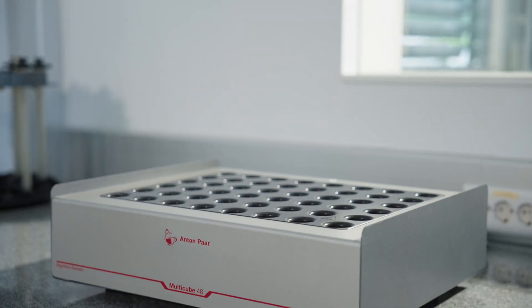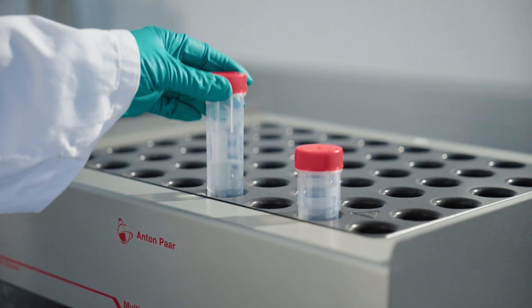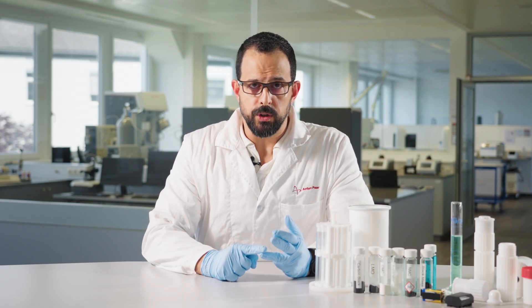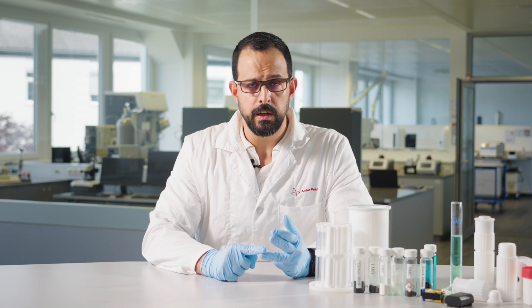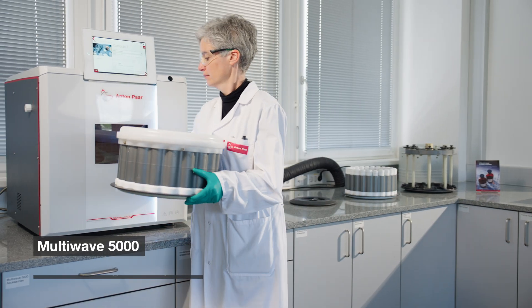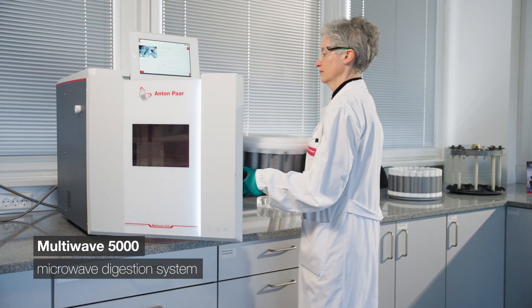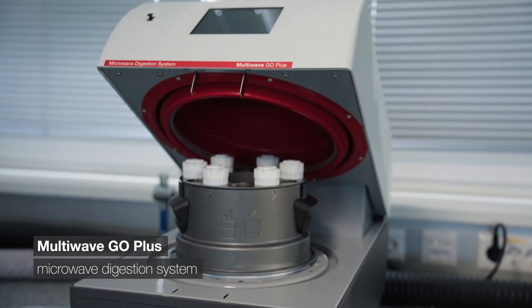A digestion block is a slightly better method to prepare samples, but would also require long times and would lead to incomplete digestions of battery materials. Fusion flux or borate fusion is a technique used to prepare near-homogeneous samples by fusing them in specialized furnaces, but this method is not typically applicable to battery materials either. For the most accurate, most reproducible, most traceable, fastest, and safest way to prepare a sample is by microwave-assisted acid digestion.